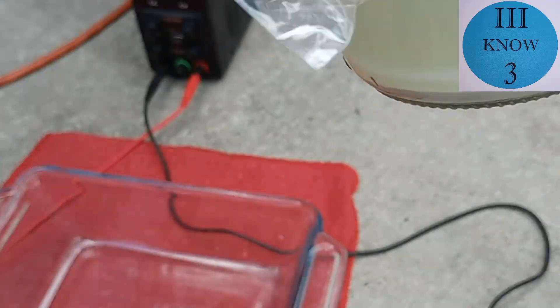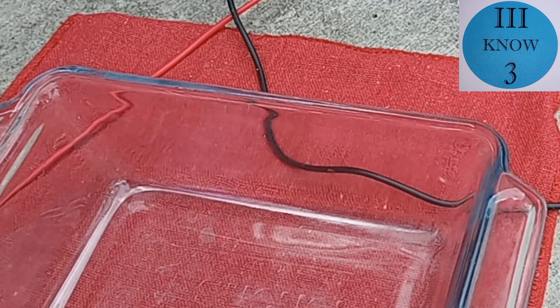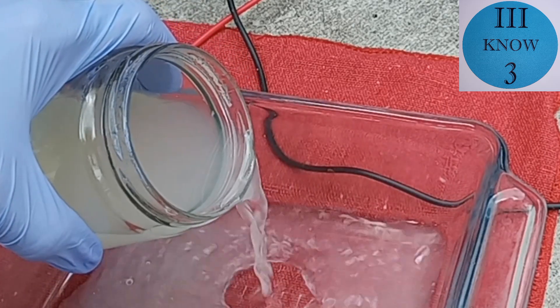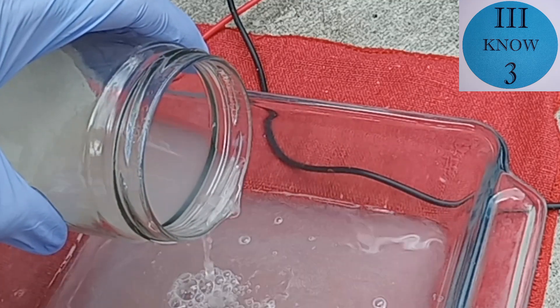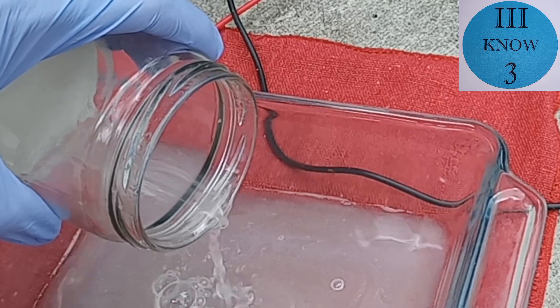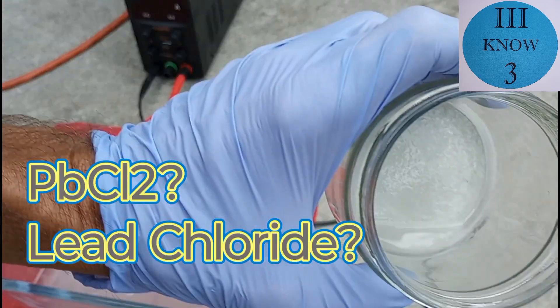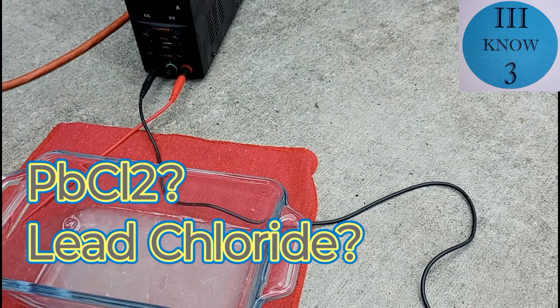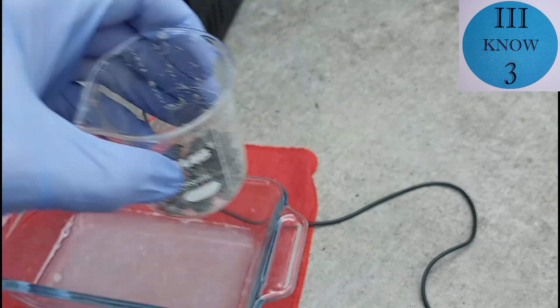And here we are the next day. Although I'm not 100% sure, I think that white substance may be lead chloride. But we can talk about that later because for now we're going to pour what is hopefully mostly stannous chloride into this pyrex baking dish and set up a tin cell. There's another look at the precipitate. And these are the undissolved pieces that now look really black.